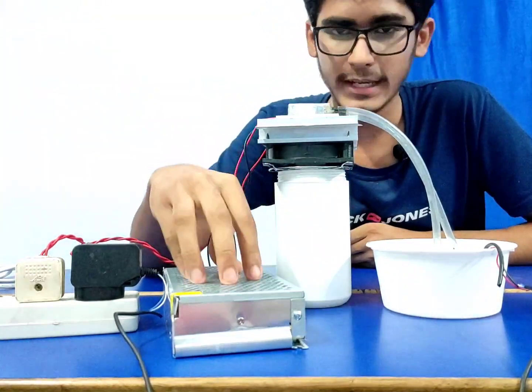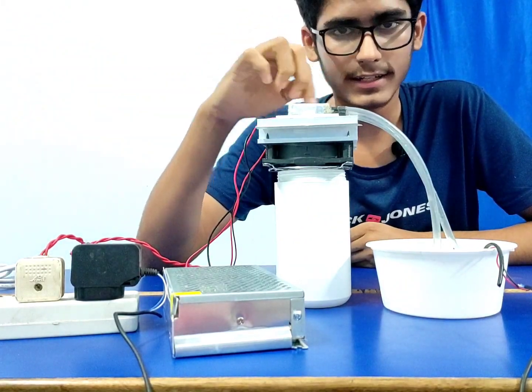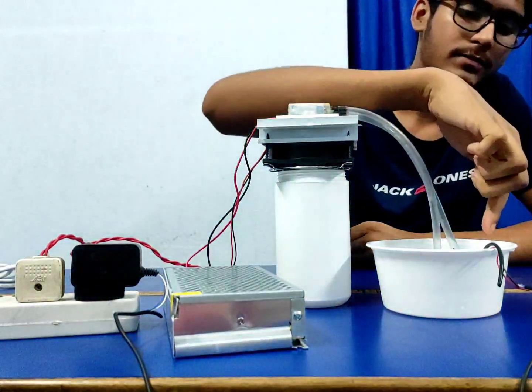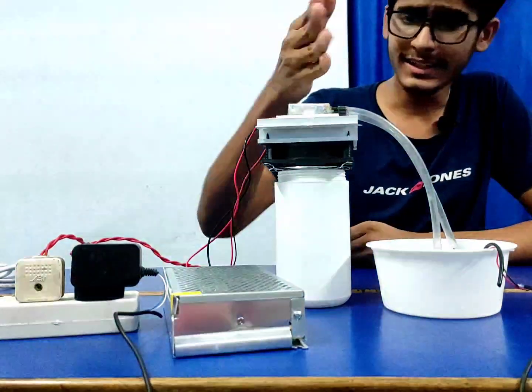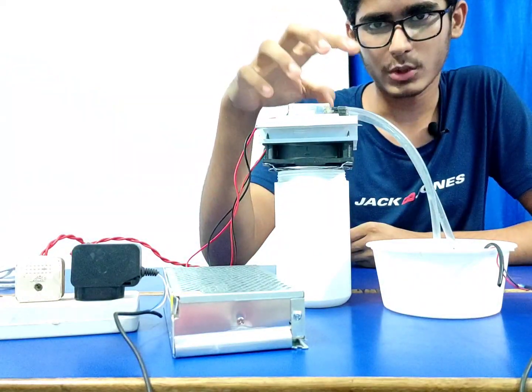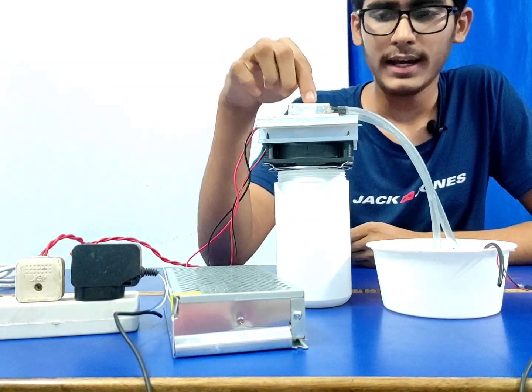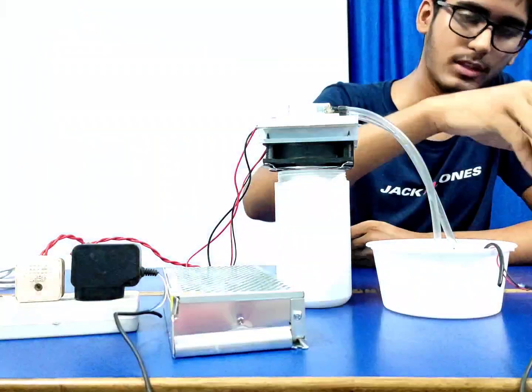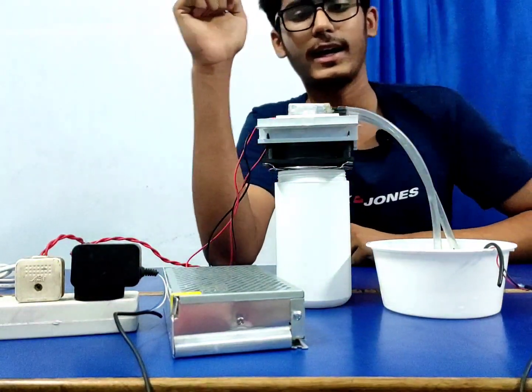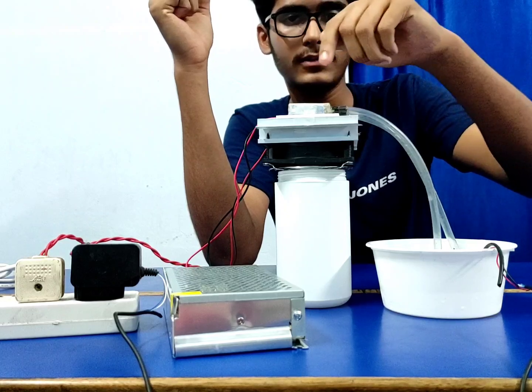Okay, so we will take power supply from this and supply it. What's happening is the cold side is connected to this water block. The water coming in through this hose runs in a zigzag pattern and gains all the cold temperature that is accumulating in this block, and again the pipe goes back to the tub and dumps the cold water. It will continue doing this for a while.